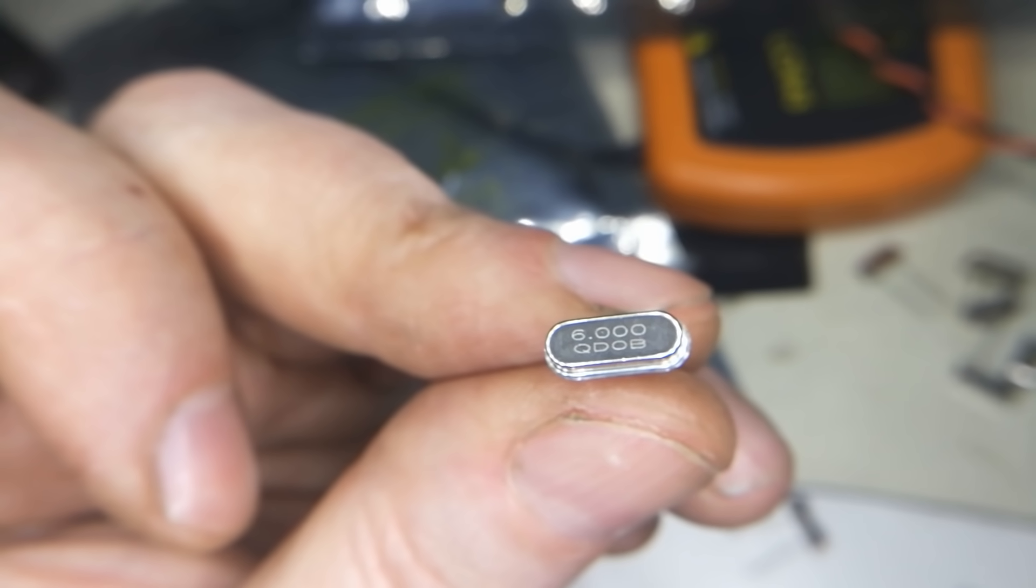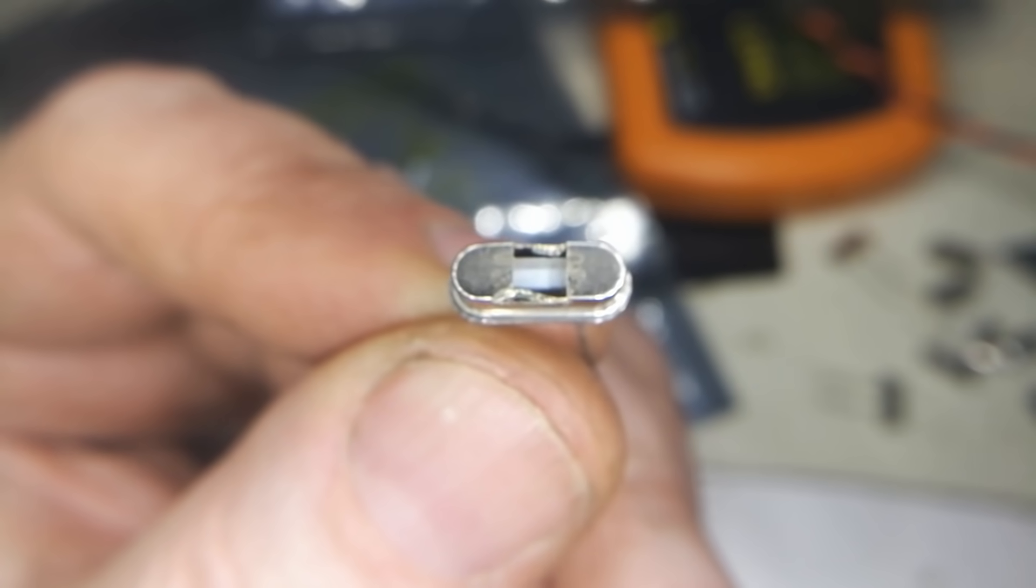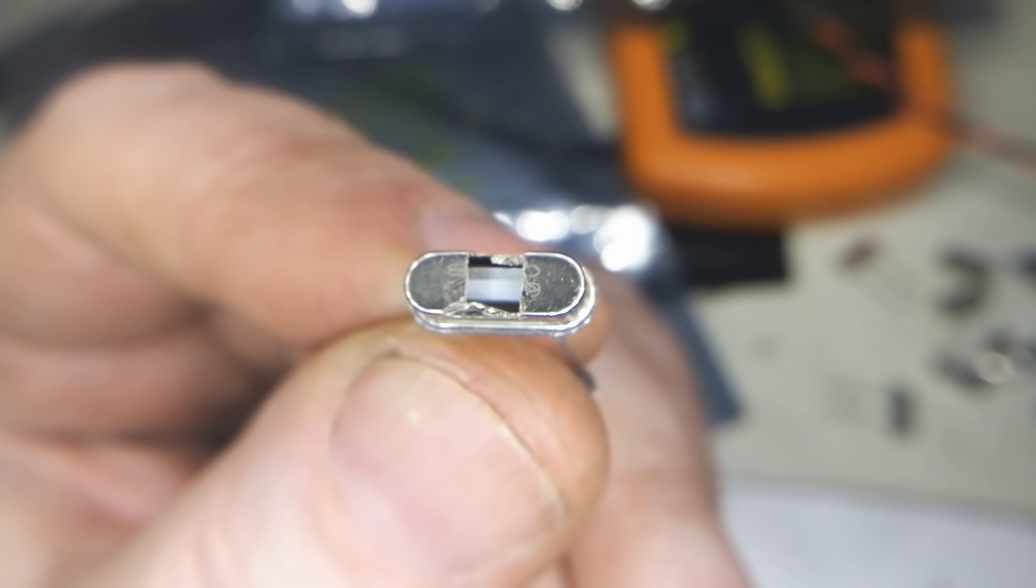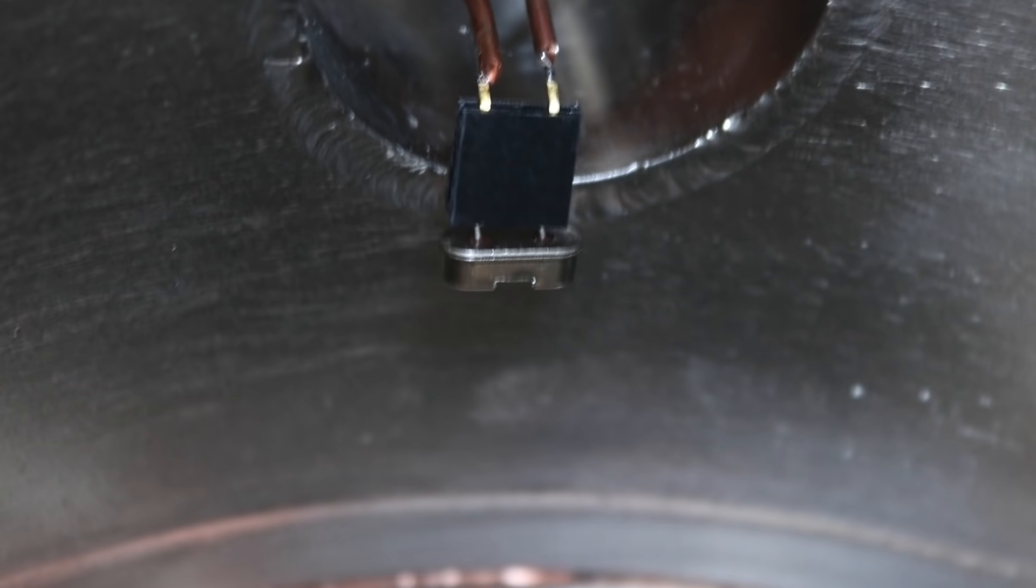I first tried if I could use some very cheap quartz crystals like the ones used in electronics by making a small modification. And while this is certainly possible, I built the configuration such that unfortunately the resonator circuit did not survive the plasma cleaning inside the chamber. So I guess there is another repair again.